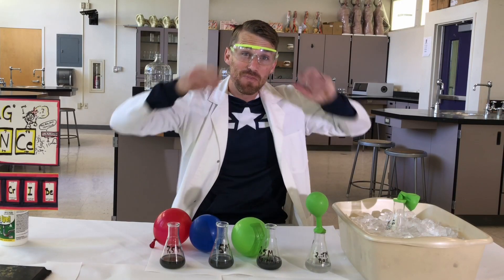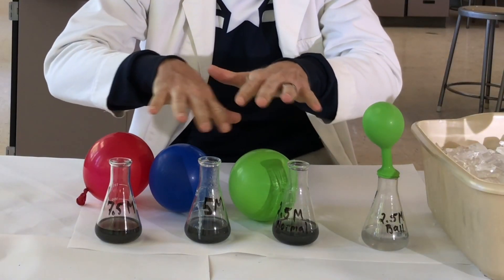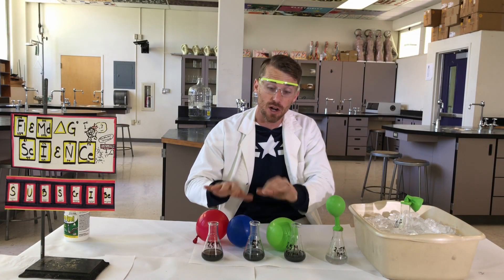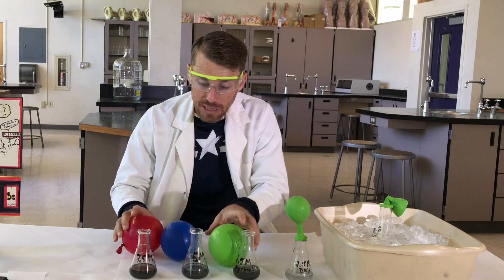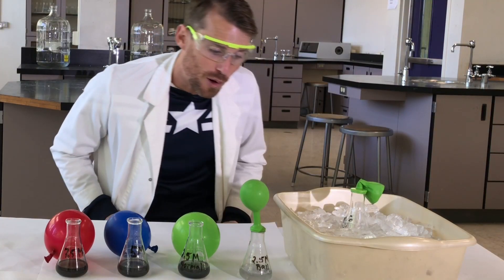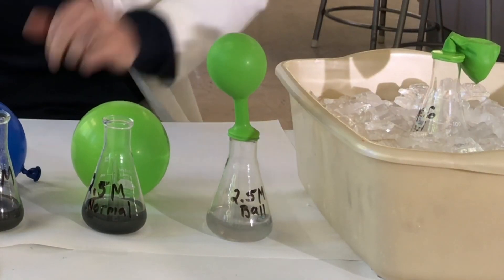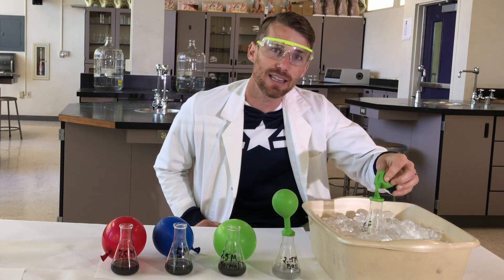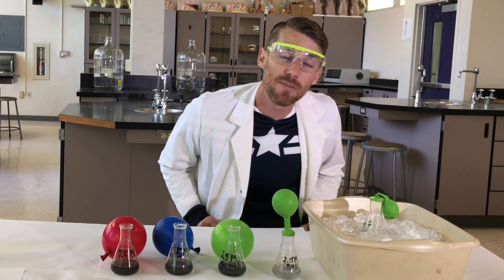Isn't that cool? We still have the reaction going on, so I'm going to keep my goggles on. But look — all three of our room-temperature ones that weren't crumpled had the aluminum totally dissolved. We have this black leftover stuff to look at in our notes, but they're all about the same size. Our crumpled ball with the reduced surface area is still going — my guess is by the time it's done it'll be about the same size also. And this one here that looks like nothing's happening actually has a few tiny bubbles going on.